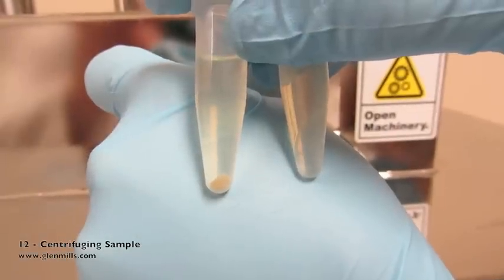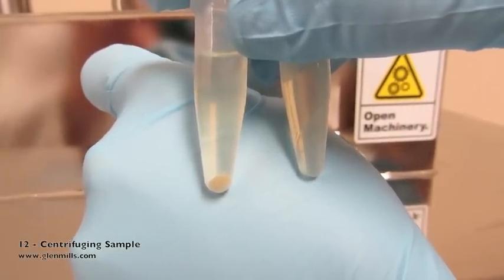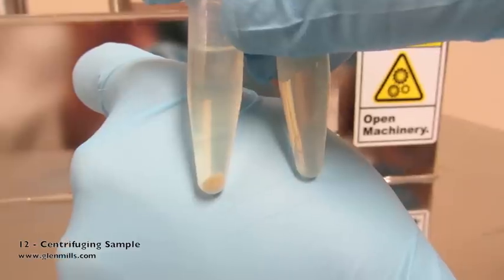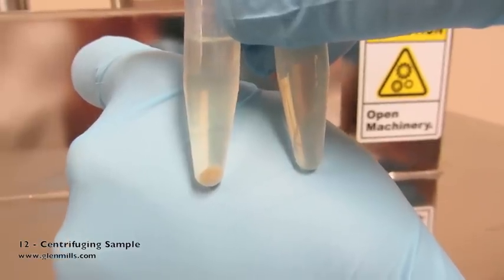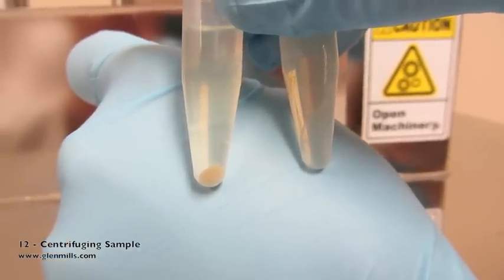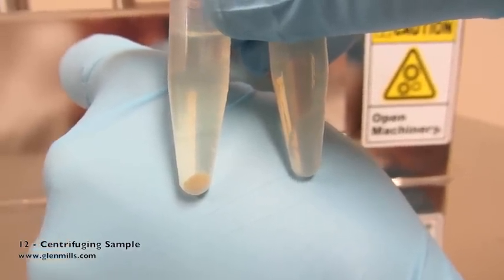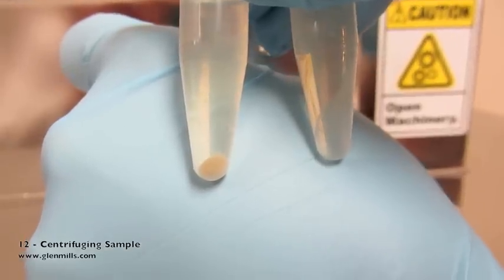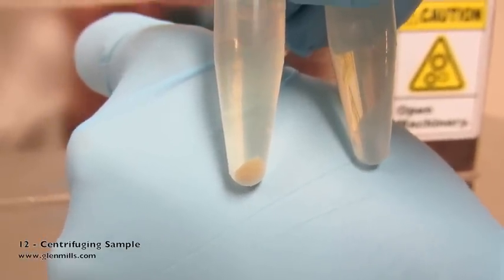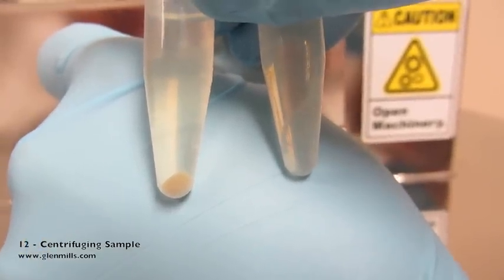Lysis can be analyzed after centrifugation by looking at the amount of bacteria still remaining in the two samples. The sample on the left is before French pressing, and the sample on the right is after French pressing. Note that there are still many bacteria present in the sample on the left, but none in the sample on the right.